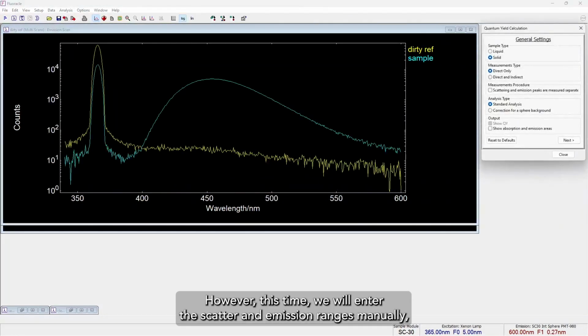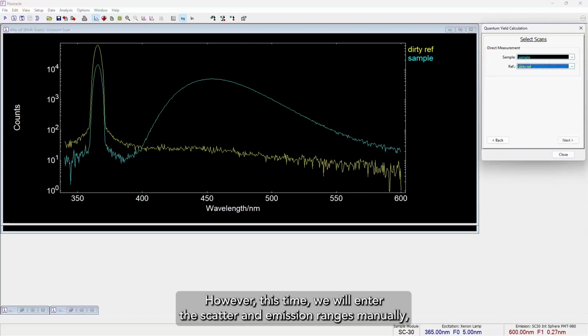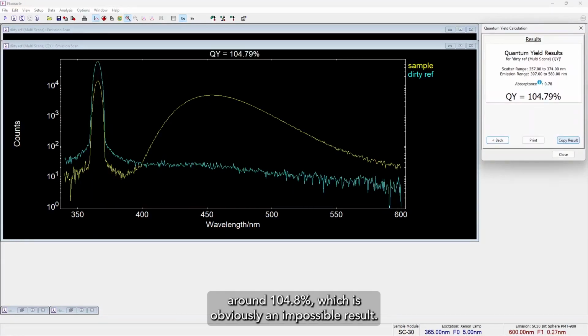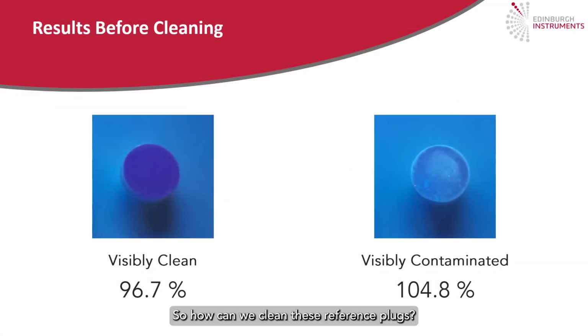We can now repeat this analysis using the Dirty Ref scan as our reference. However, this time we will enter the scatter and emission ranges manually rather than highlighting them. This results in a PLQY determined to be around 104.8%, which is obviously an impossible result. So how can we clean these reference plugs?